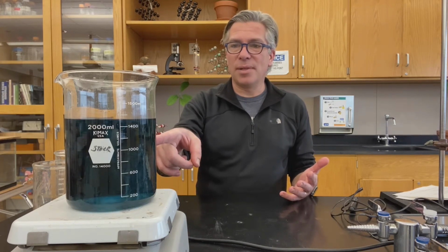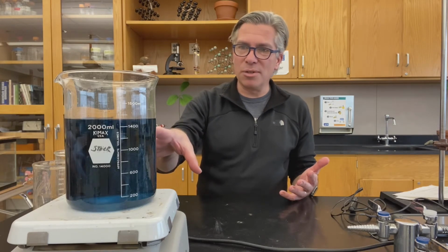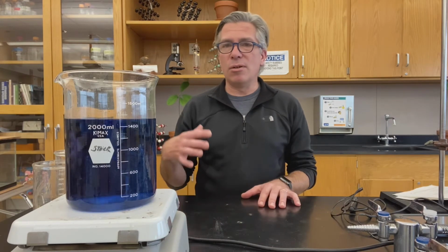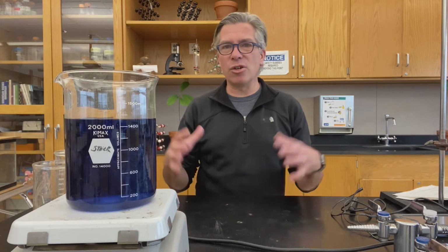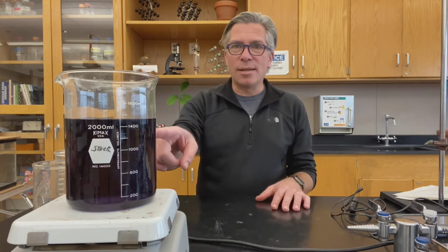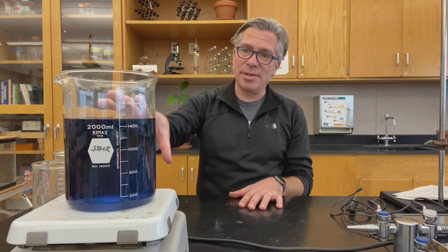That's cool. Now we had like a green color, and now it's shading toward blue. So awesome. There's a lot of things going on in here. You know, that initial green phase was when the ions all got in there, and it's kind of like showing up to a party. You have to kind of look around and introduce yourself and see who's all there, you know, to see what kind of action can happen. Oh, do you see that? Back to sort of a red color. Give it a second. Give it a second. Oh, there we go. He didn't let me down.